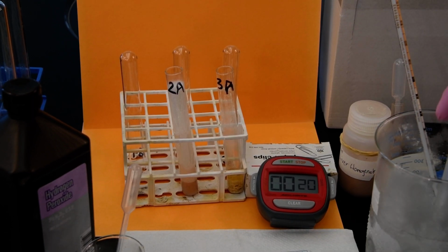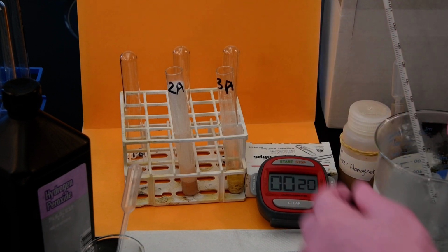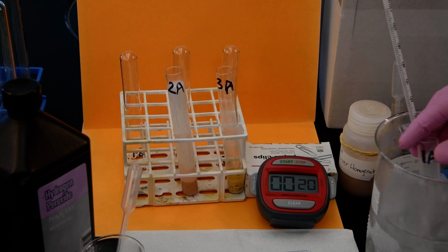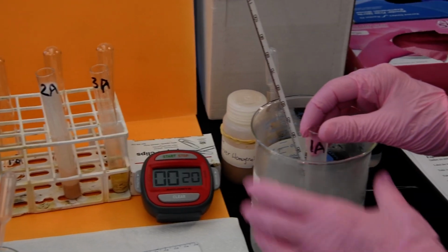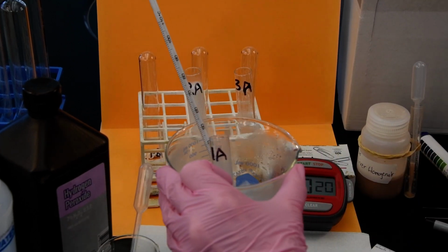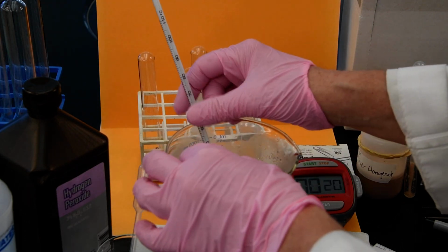All right, and so to complete the effect of temperature on catalase enzyme activity specifically, we've had 1A in the refrigerator in an ice bath for a little over 15 minutes, and we're going to add the hydrogen peroxide to it. I'm going to add it in the ice bath so I can put it in frame. Okay. I'm going to add it directly, and then I'm going to pull it out, and we're going to take a look at that.